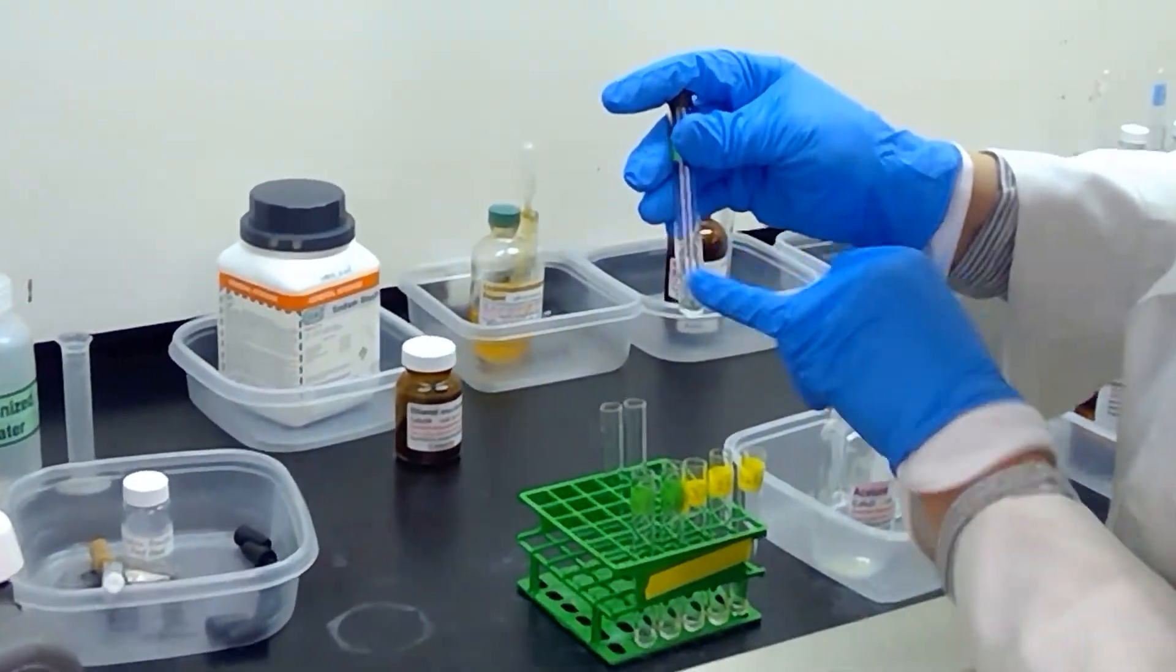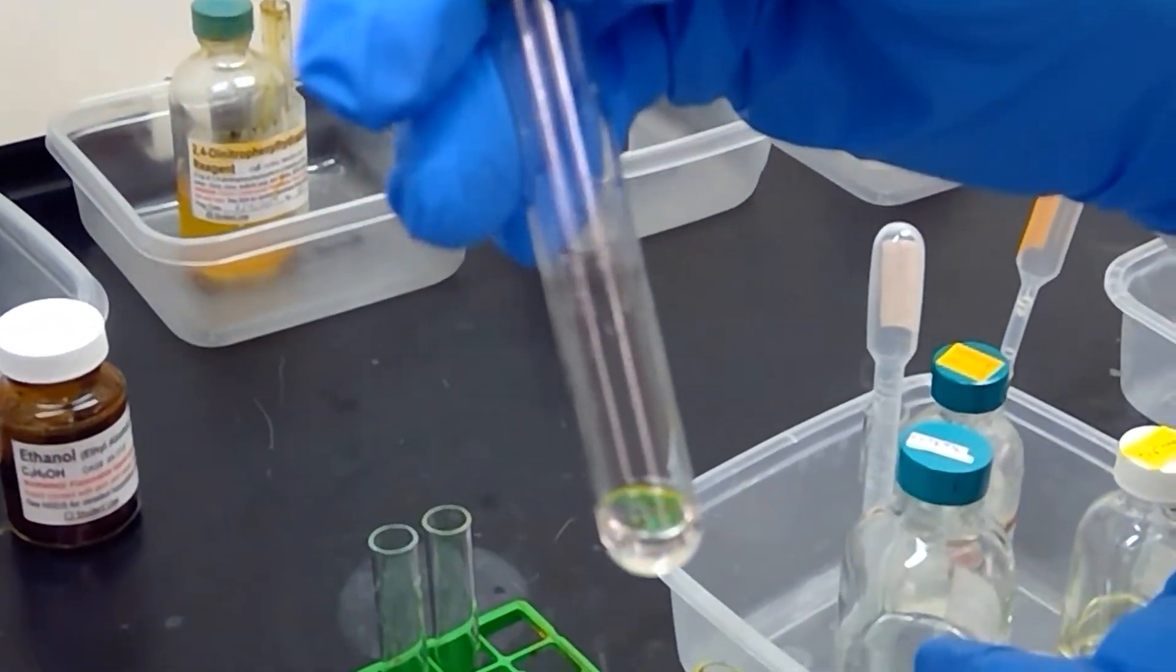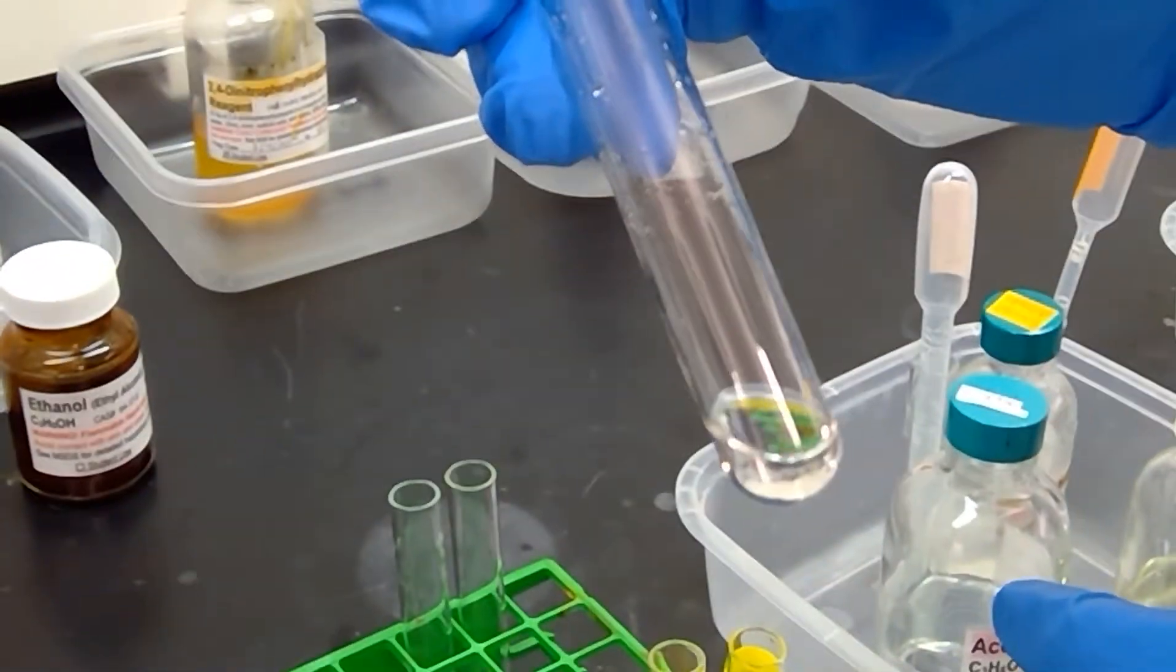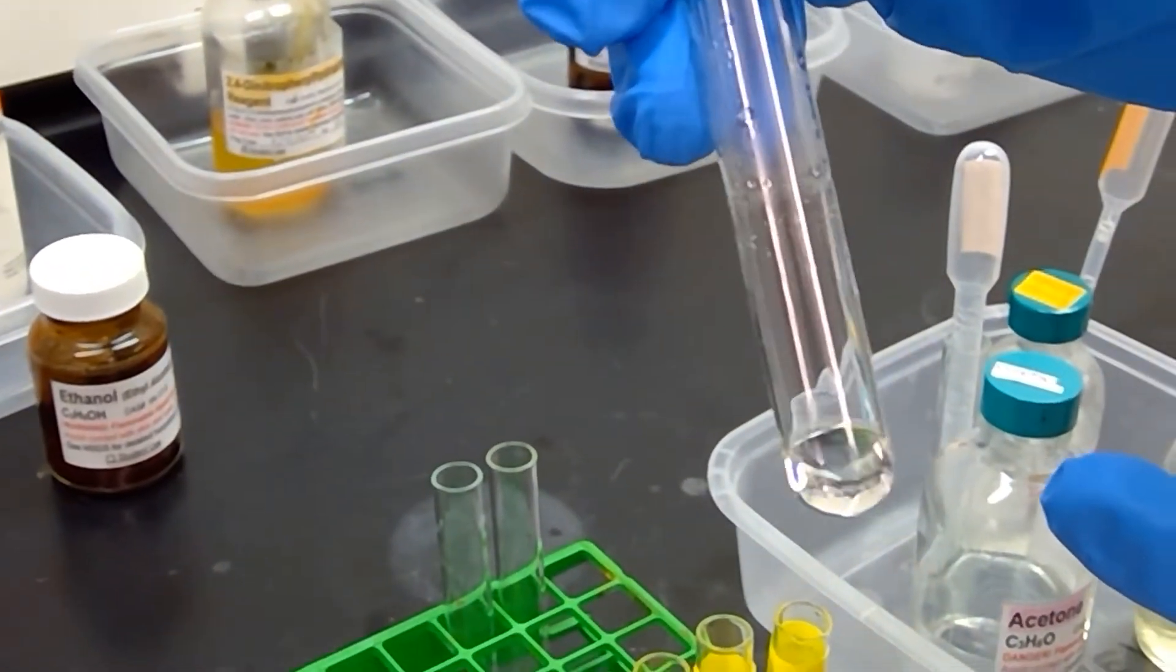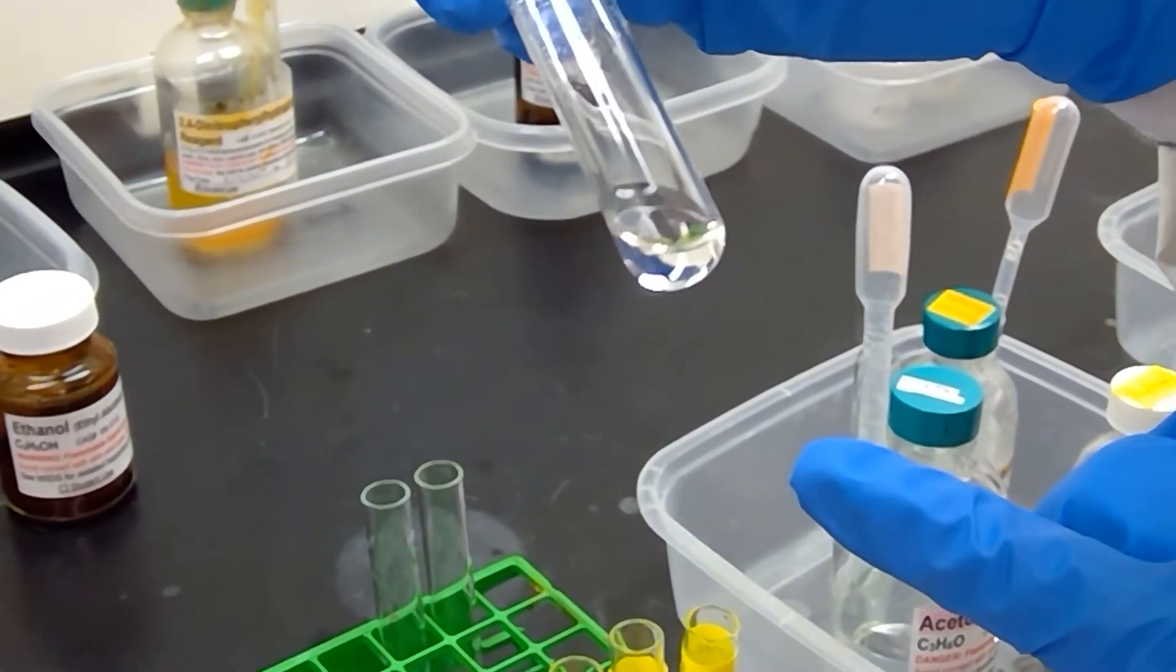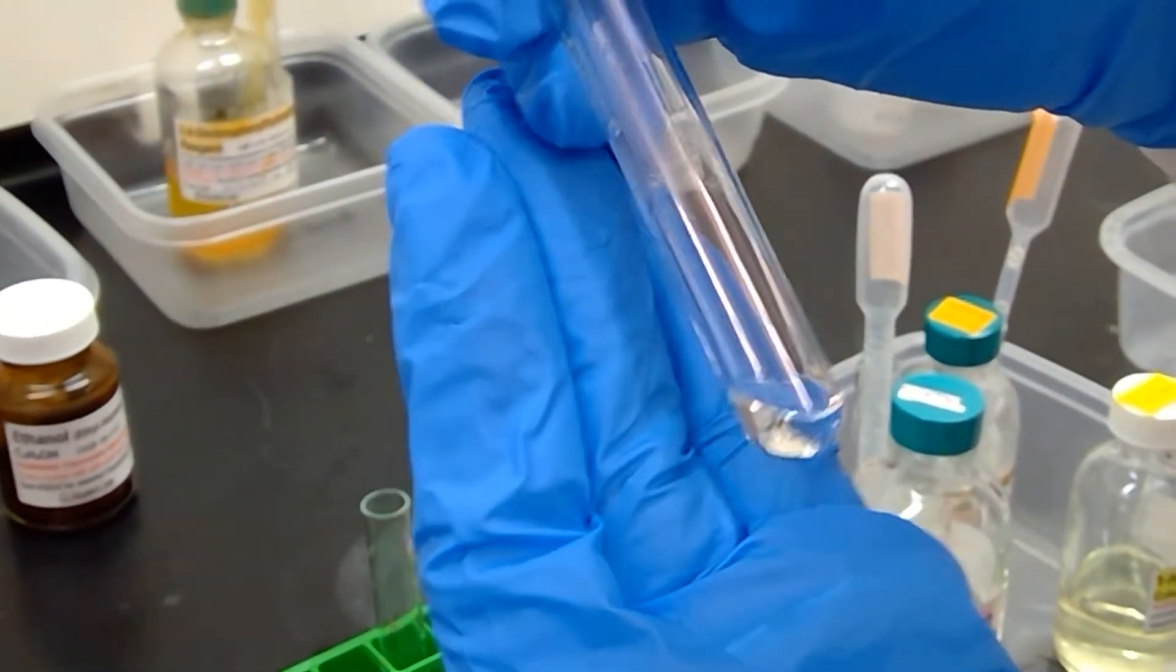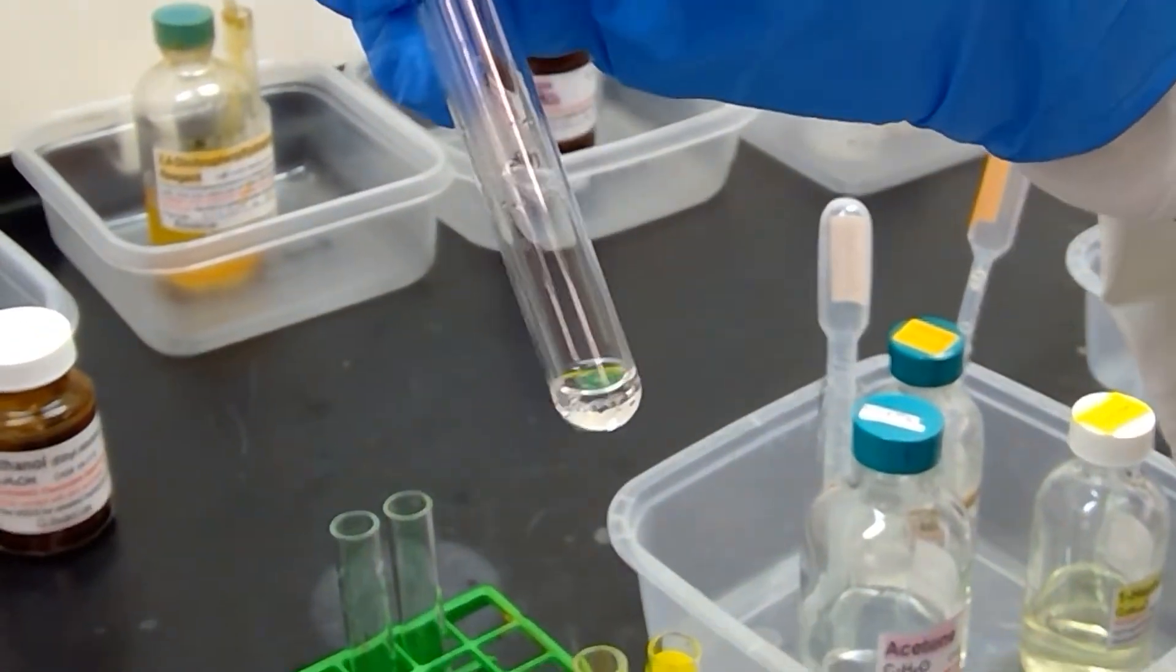And I will ask Lee to bring the camera a little closer so we can see if we start to get some precipitate. And we had some precipitate initially but it kind of dissipated when I shook it up again. Let's see if we get anything. Okay, well we will set this one aside.